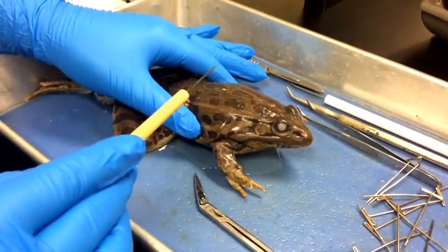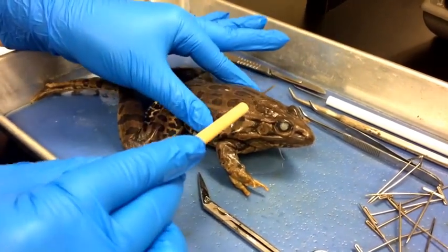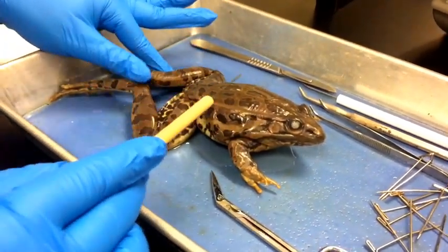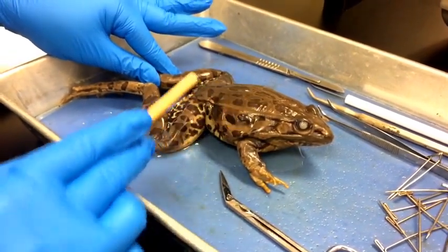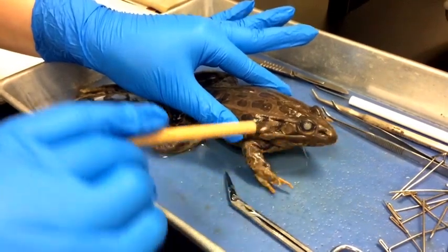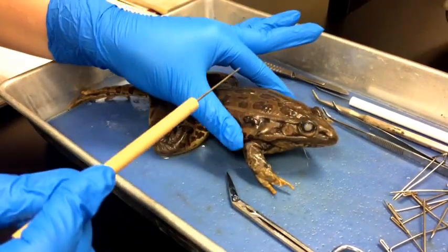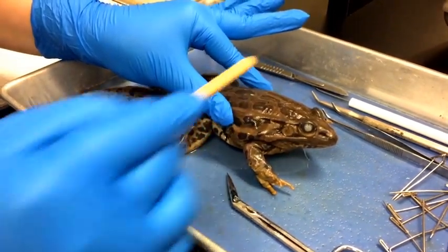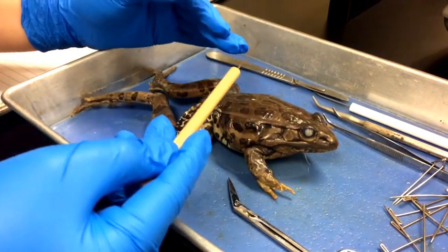After the countershading, we're going to discuss the skin structure. The skin envelops the entire body and the frog uses it for respiration while it's underwater. Instead of using the nostrils — the nostrils have a membrane that closes over — and oxygen is moved through the water-permeable skin. So it absorbs the oxygen.